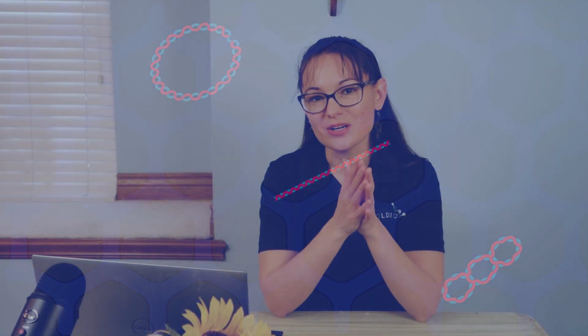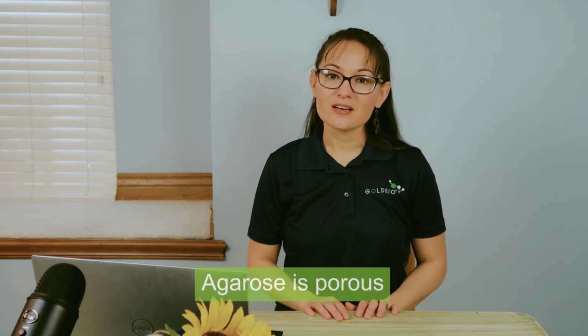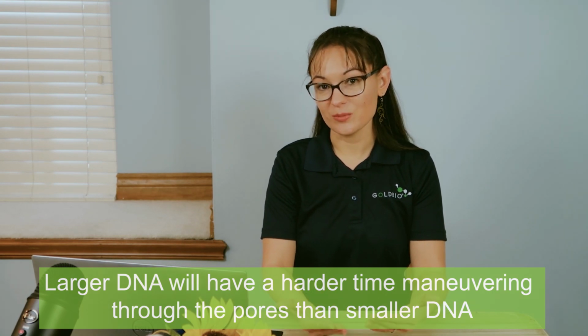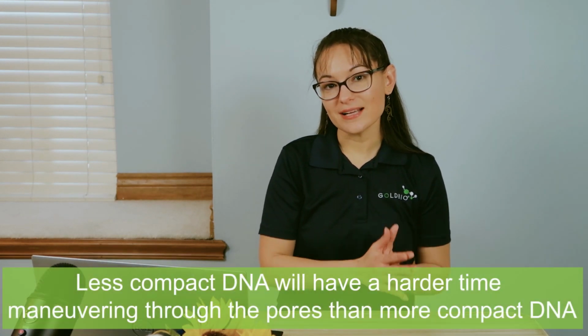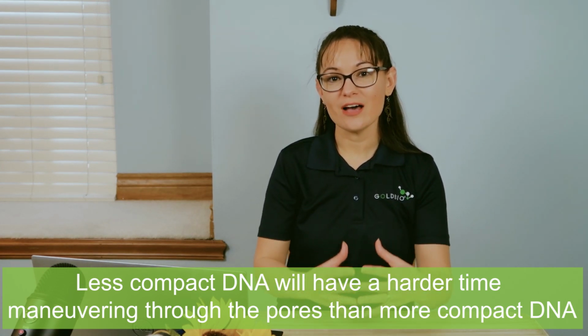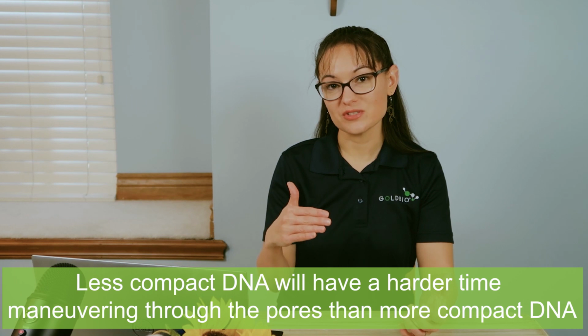Hopefully this helps you better understand how you would interpret the results of your gel electrophoresis when it comes to plasmid DNA. Remember, the takeaways here are that agarose is porous. Larger DNA will have a harder time maneuvering through the pores than smaller DNA will. Finally, less compact DNA, such as that relaxed, nicked open circular DNA, will have a harder time maneuvering through those pores as well. And that's compared to the more compact DNA, like supercoiled DNA, which will move a lot easier.